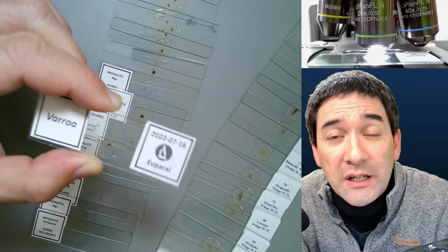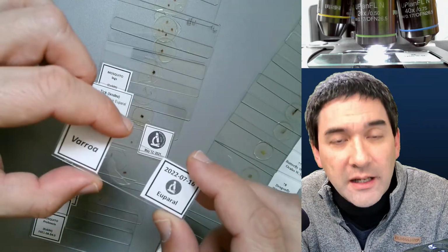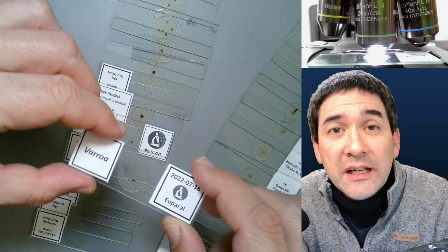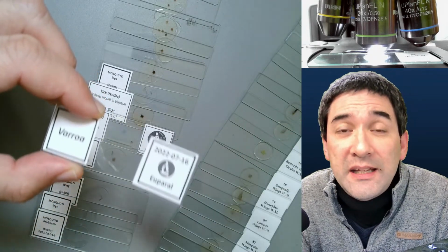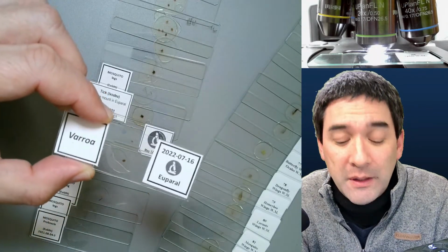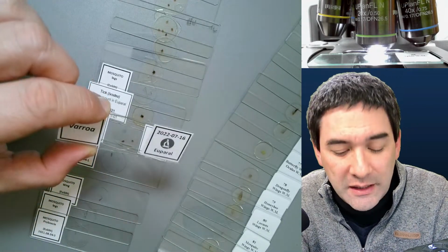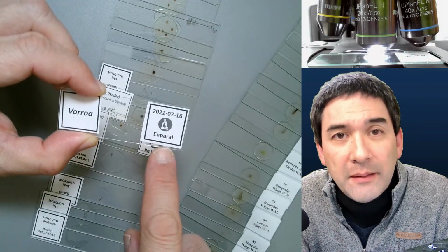That mounting medium is a standard which is used by entomologists. These are people who are preparing insects, because it has a so-called clearing activity. This basically means that after a couple of days, or maybe after a week, the insect does not stay as dark anymore. It starts to brighten up.